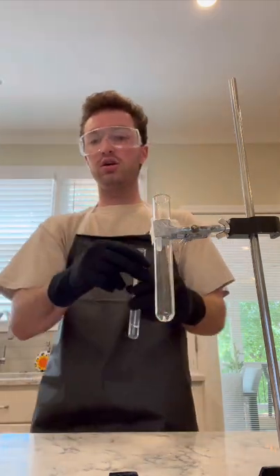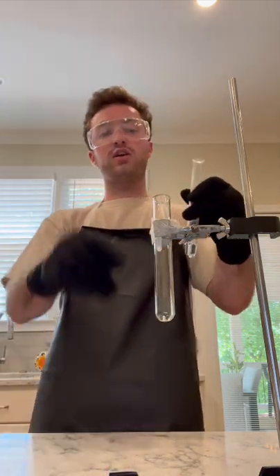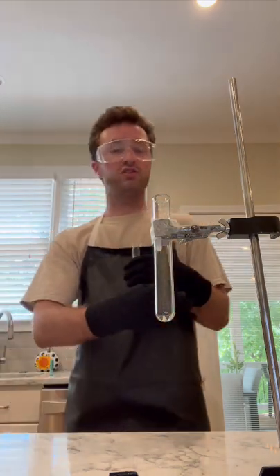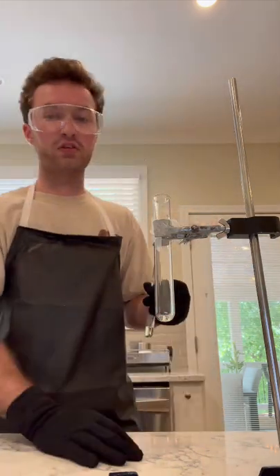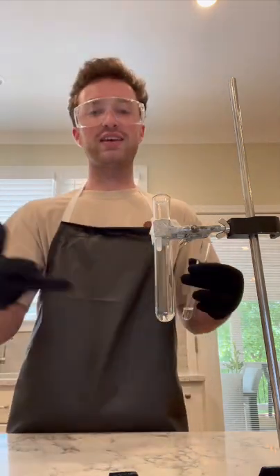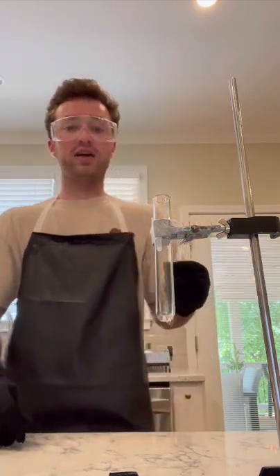What I'm going to do is pour this HCl carefully into here and just watch the reaction and record any observations. I was given a forewarning that this reaction may take a minute just to kind of get started. So I'm just going to go ahead and fast forward until the reaction starts.